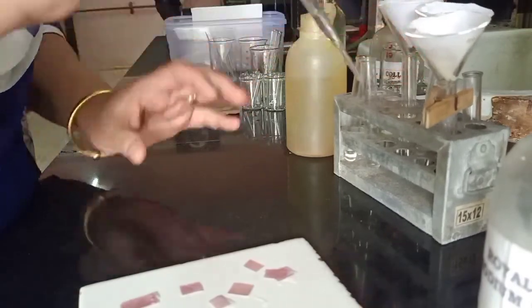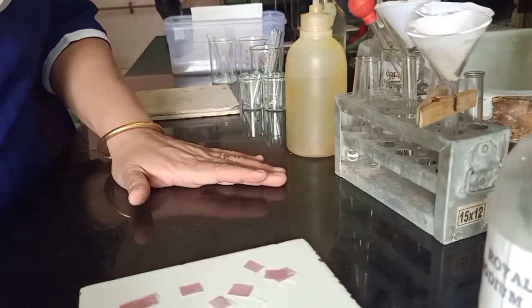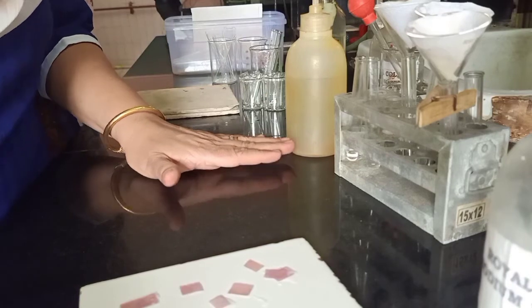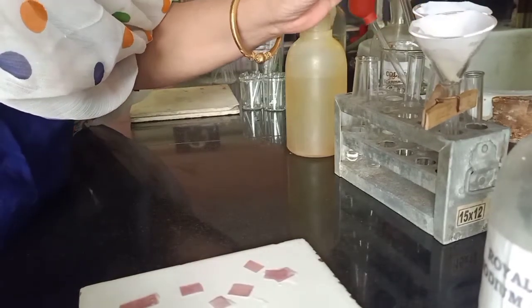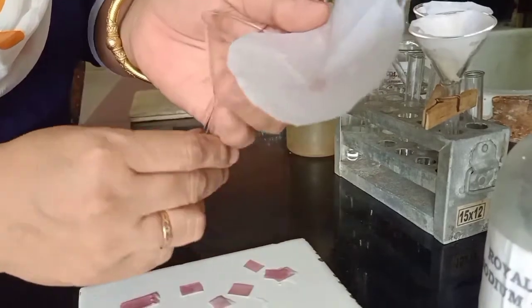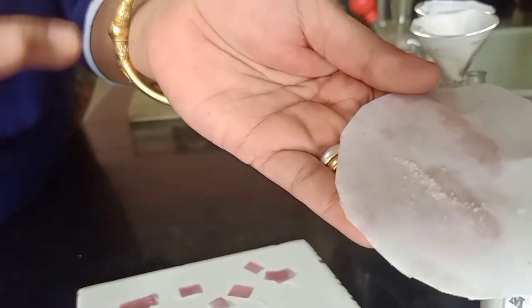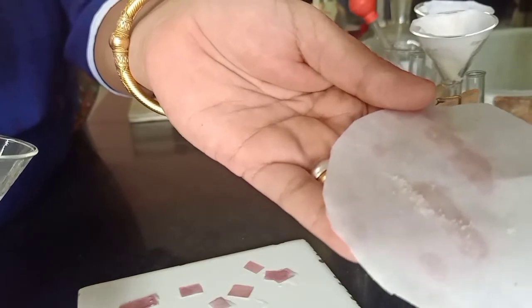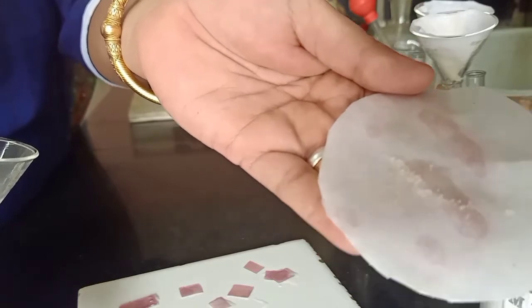Hence we can assume that our base is also absent. We have got indication of only one component detected by chemical reaction — that was the first reaction where we had effervescence, suggesting an acid is present. But we did not get re-precipitation, therefore it may be a water-soluble acid. However, we have got base absent, phenol absent. Therefore our only option for the second component could be neutral. The residue did not give the test for phenol, nor for a base, but it remains unchanged — so if a residue remains after all the tests, it is to be assumed that this component is a water-insoluble neutral compound. Component A may be a water-soluble acid; Component B is a water-insoluble neutral.